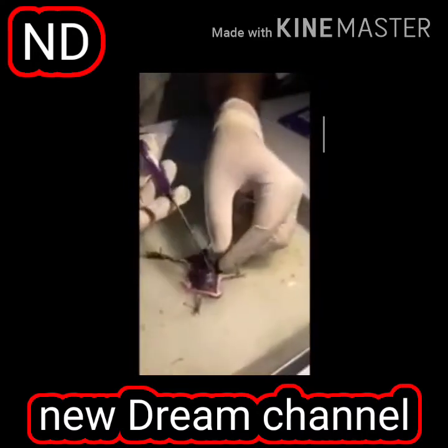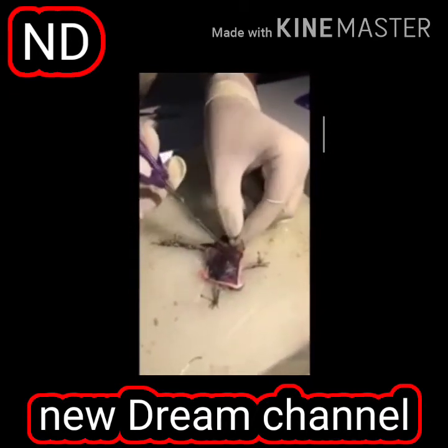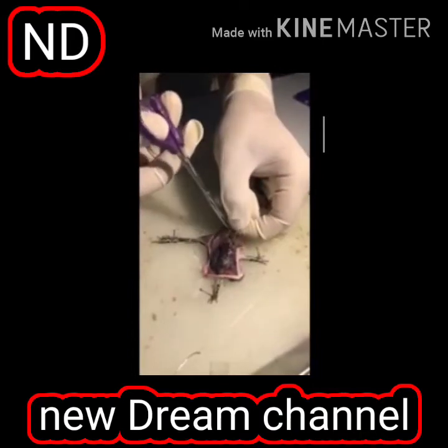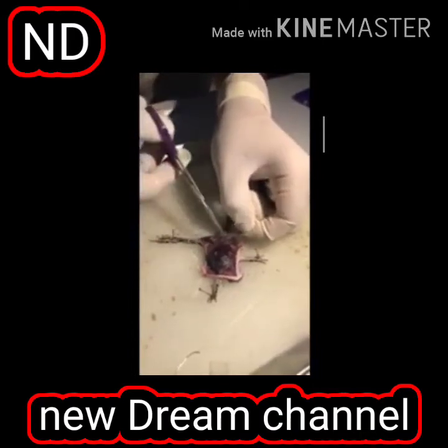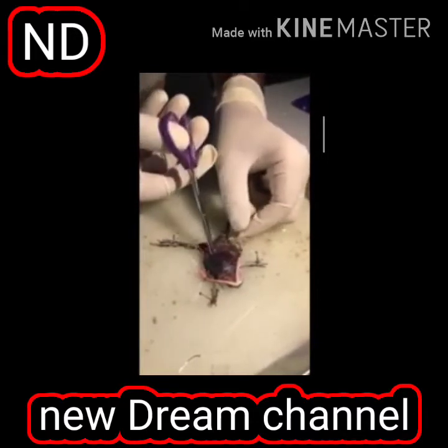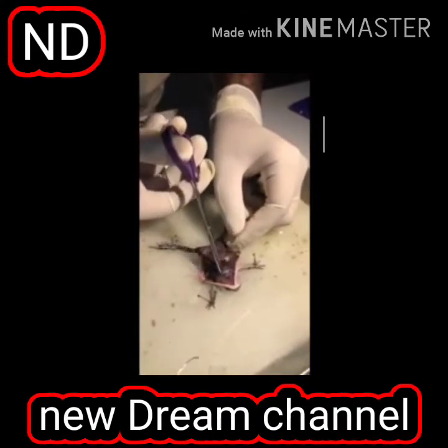Now we see the frog here. We can cut the peritoneum. This is the peritoneum lining. We cut it here. One more lining. You can see all its parts. I will tell you each and every part.